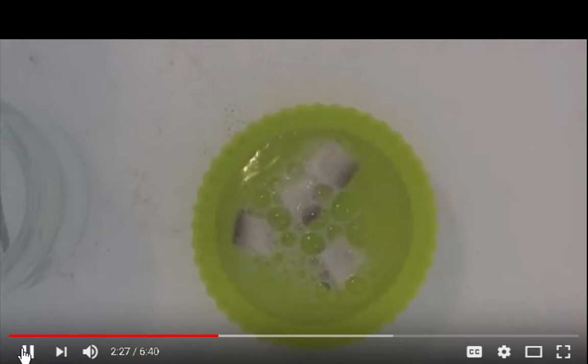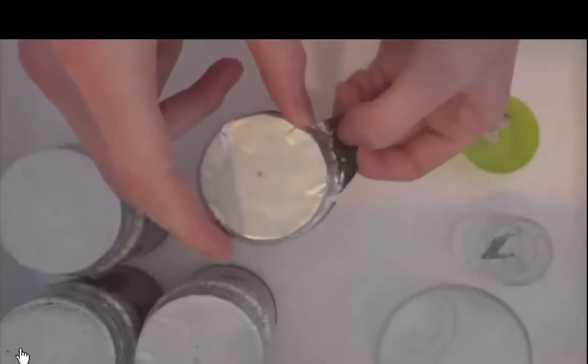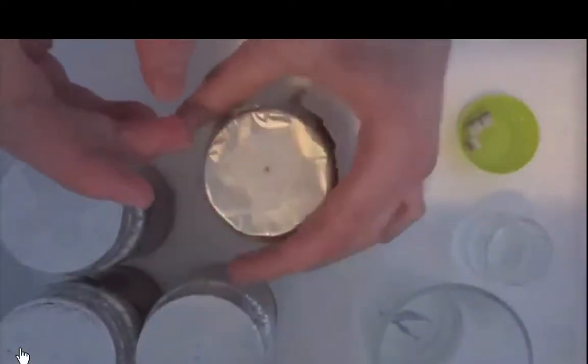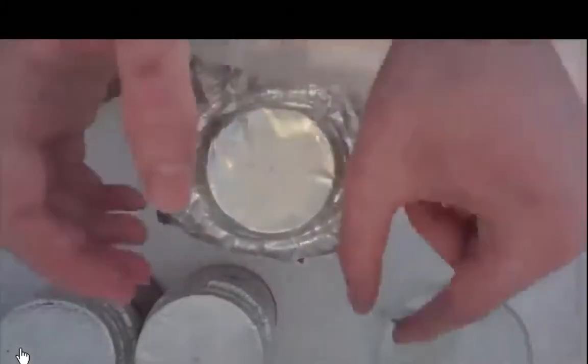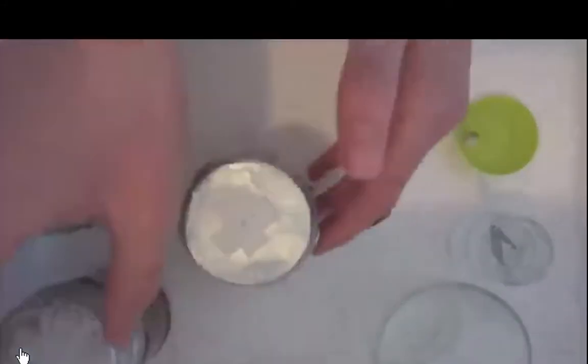20 minutes. This makes sure they are sterile and any mold spores or contaminants on their surface is killed, but the mycelium in the middle survives, or the mushroom tissue in the middle survives. But yeah, so I just open up the agar plate and use some sterile tweezers to drop in the small cube of mushroom. I then repeat this 3 or 4 times. It really doesn't take long, and I'm doing this in a still air box, which I sprayed out with a liberal amount of surface cleaner, which I find works very well.